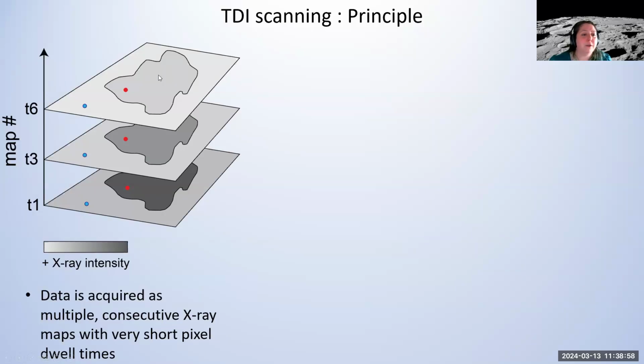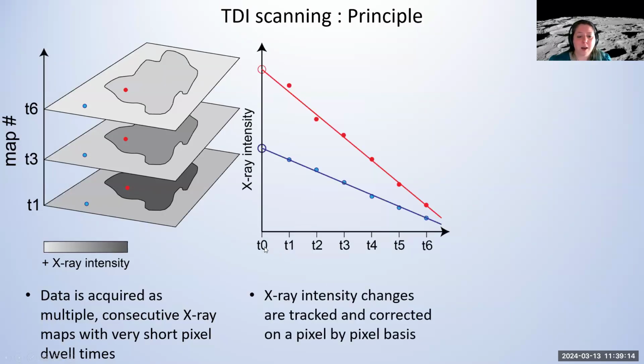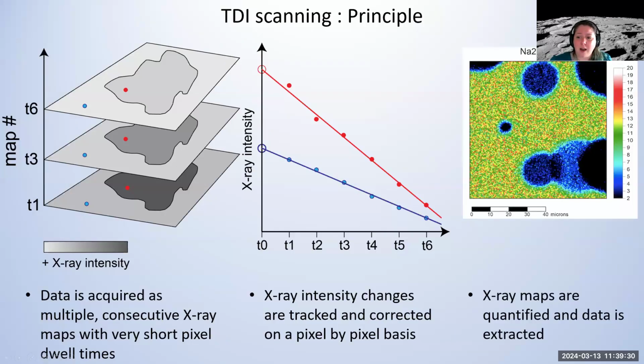And so here's an example where you have a phase of one composition and surrounded by something else. And so when we just track 2 pixels, one in the outside phase and one of the mineral of interest against time instead of intervals, now our timeline is different maps. And so for each pixel, then we can correlate the individual pixel intensities and plot them against time. And with that, then again, just as in PFE itself, we have different types of fits to this, and try to see how it is. And then with that, we can quantify the data and correct for any beam sensitivity that might have affected even the maps.